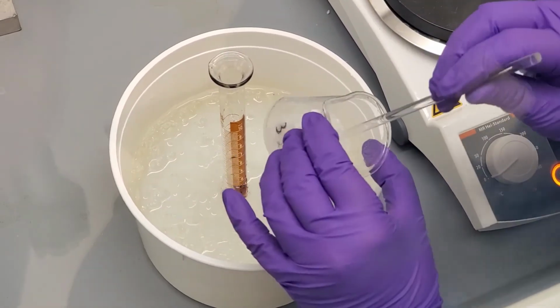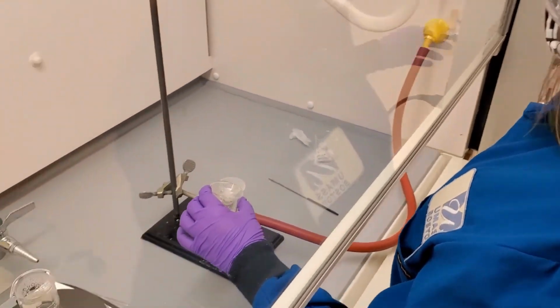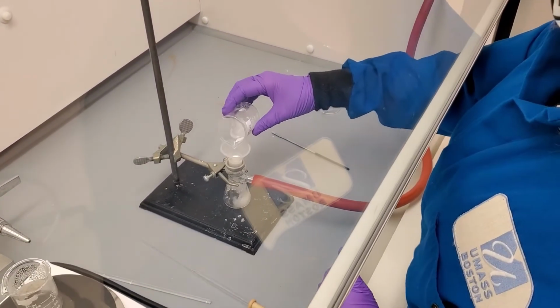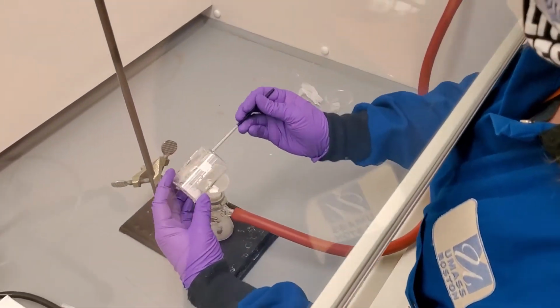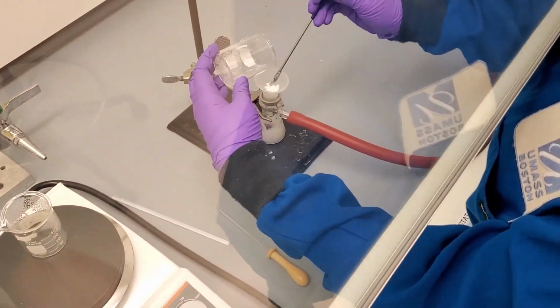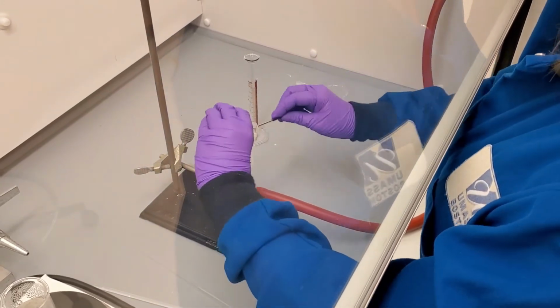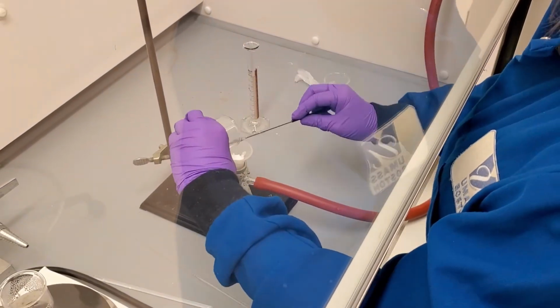When we no longer notice more crystallization, it is time to filter the pure salicylic acid. Turn on the vacuum and slowly pour the water with the pure product through the Hirsch funnel. Scrape as much of the crystals as you can into the Hirsch funnel. Because there are still crystals in the beaker, we will rinse it with ice-cold water and pour it into the funnel. We use ice-cold water to avoid dissolving any product while rinsing out any impurities from the product in the funnel.